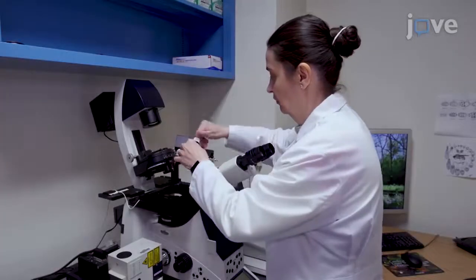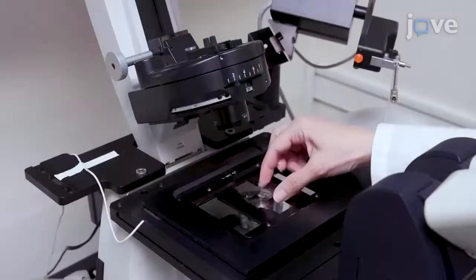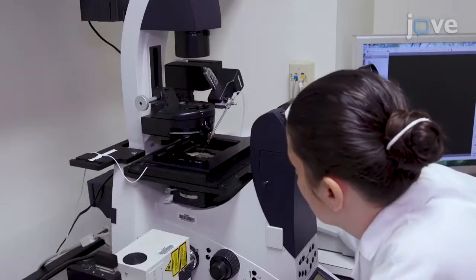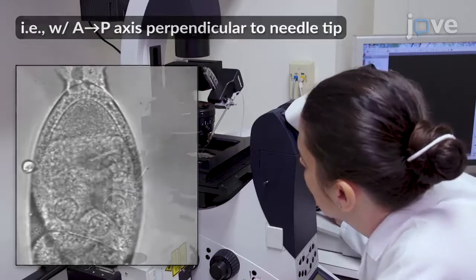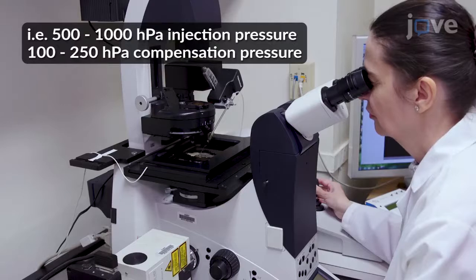For molecular beacon microinjection, select the 40x oil objective and mount a cover slip with a dissected egg chamber onto the microscope stage. Locate an egg chamber at the mid to late developmental stage that is properly oriented for microinjection. Then set up a microinjector with the appropriate injection and compensation pressures.